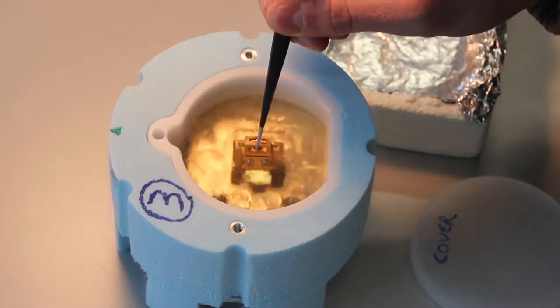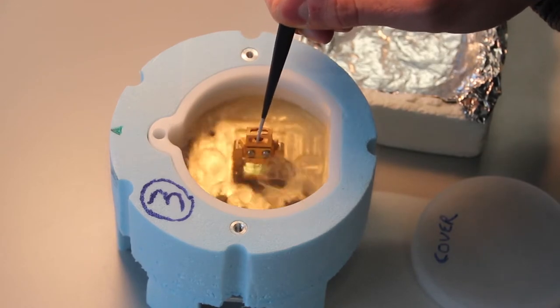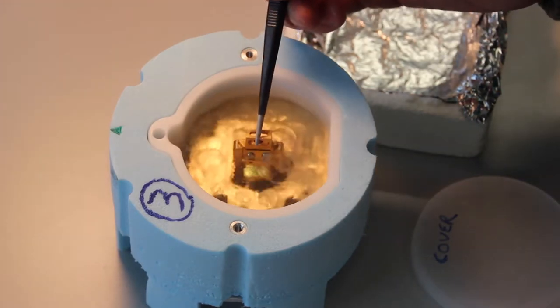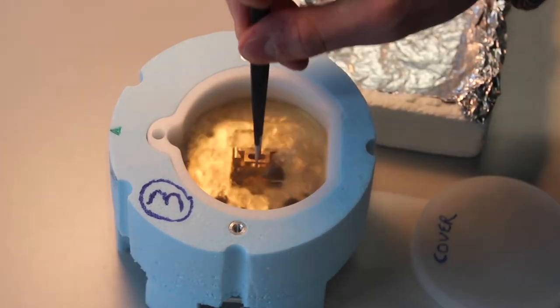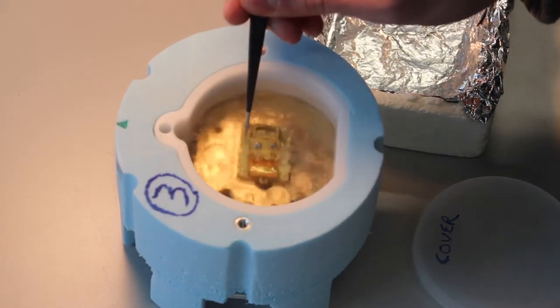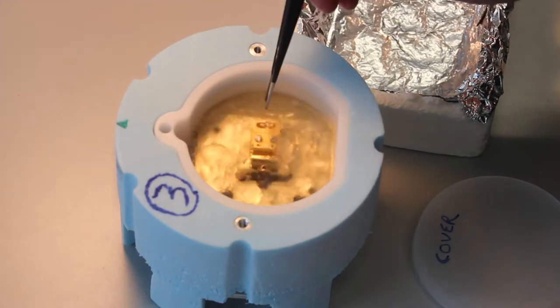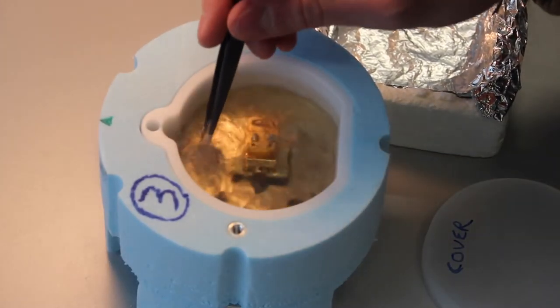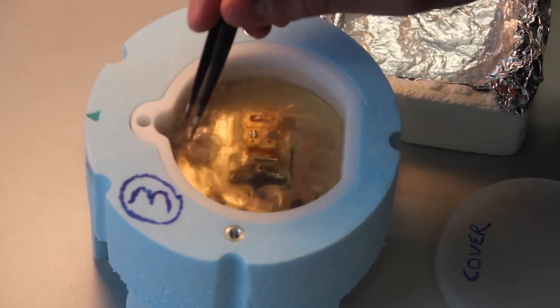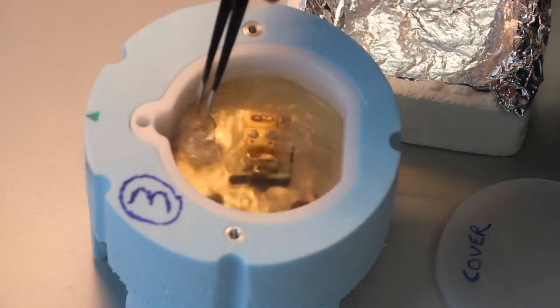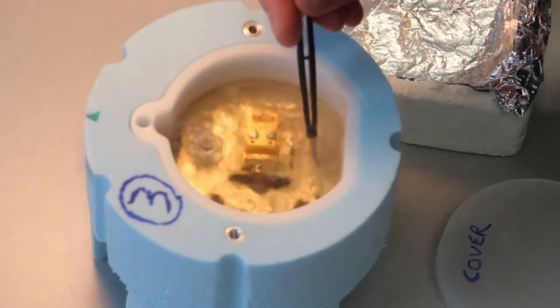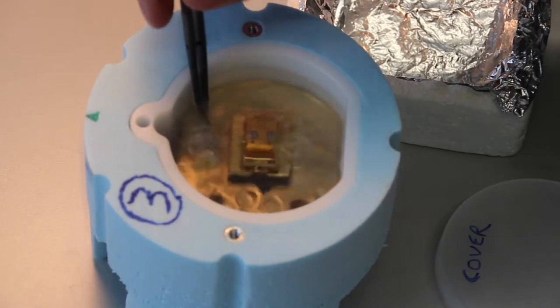Now the transfer box is cool. Make sure you try and minimize the contamination at this point. The shuttle goes in as such, then rotate it back for loading so that it's flat, and we can cool down the clipping station. I'm going to get out my grids and grid box over here, ready for clipping.